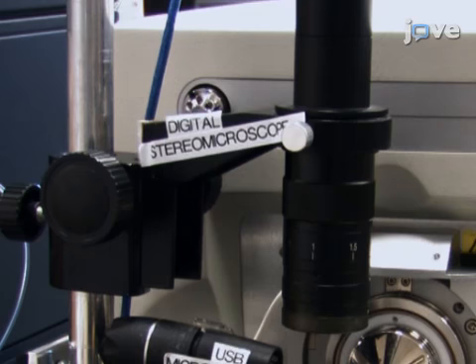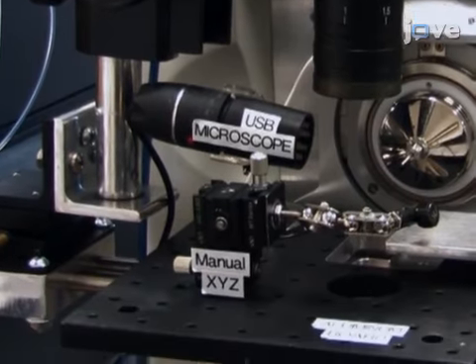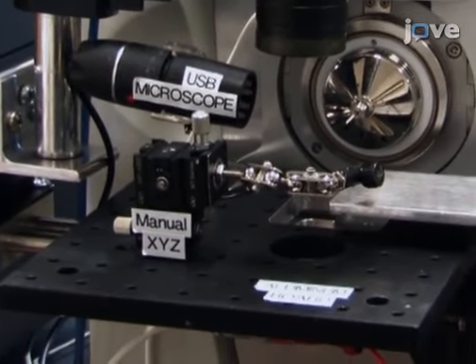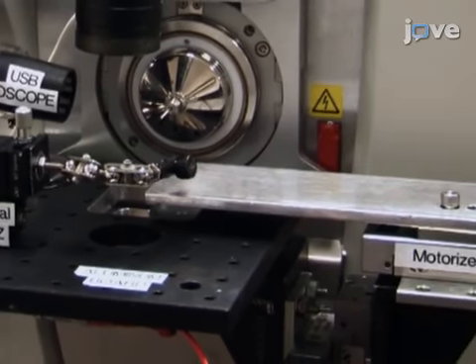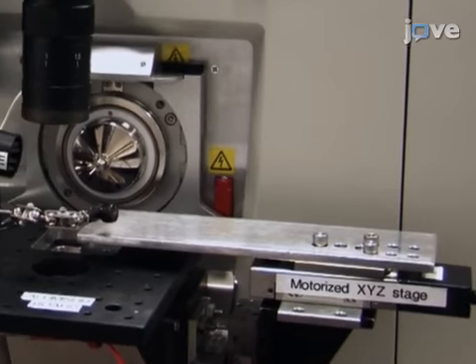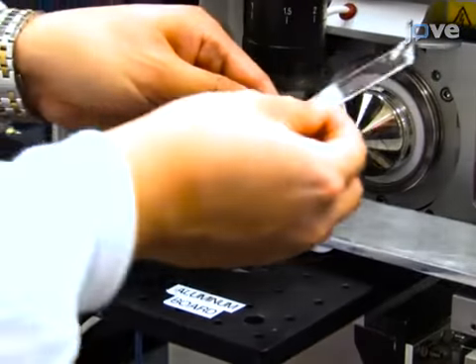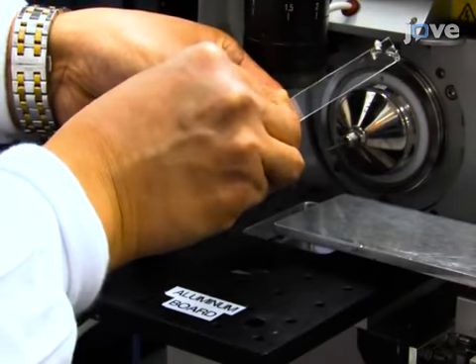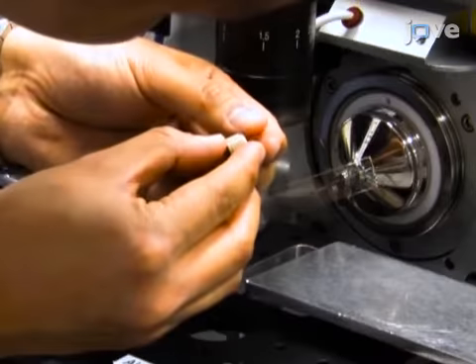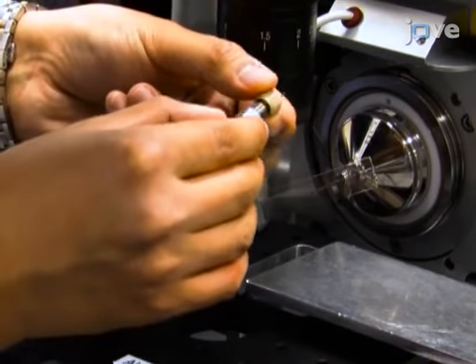Attach the modified digital stereo microscope, a USB digital microscope, a miniature manual XYZ translation stage with a flexible clamp holder, and the motorized XYZ translation stage system to the aluminum optical board. Use the flexible clamp holder to fix the glass slide attached with a single probe. Then, attach the single probe setup to the mass spectrometer.